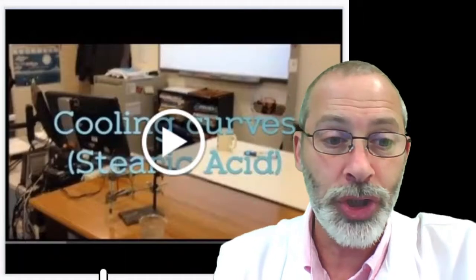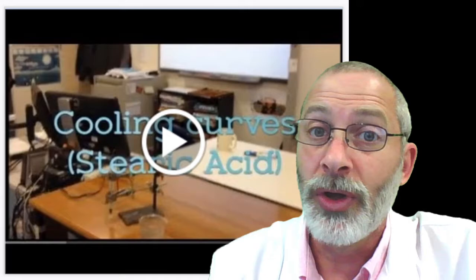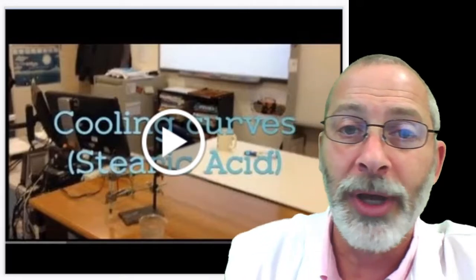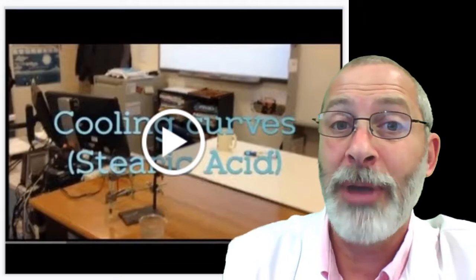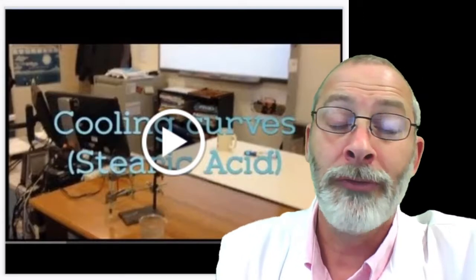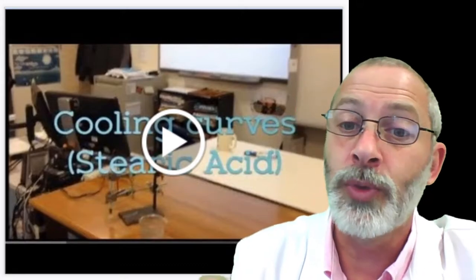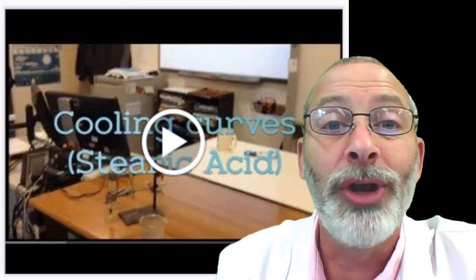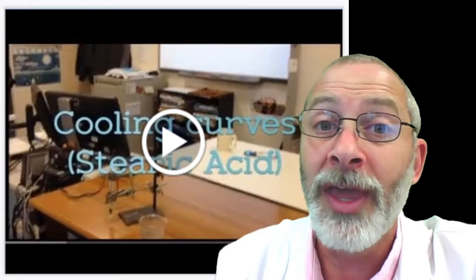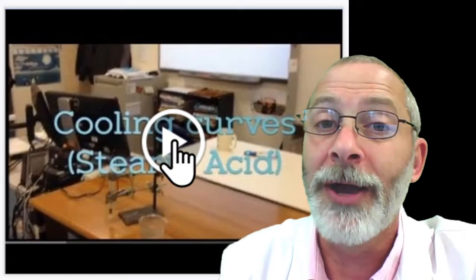Now, since we may not be able to see this in real life this week, I have a video that I'm going to show you that I found regarding another substance called stearic acid. We used to use stearic acid with this lab years ago, but I have found wax, paraffin wax, actually works much better for our purposes. So if we get a chance to do this in real life, we'll be using wax, but the same thing happens with this substance called stearic acid. So we're going to watch this video right now, and then we will gather some data for our own lab. So check it out.